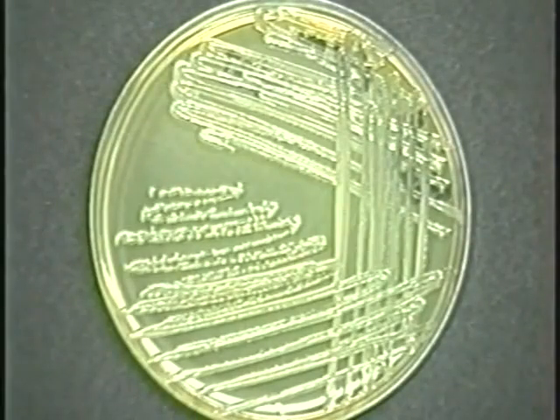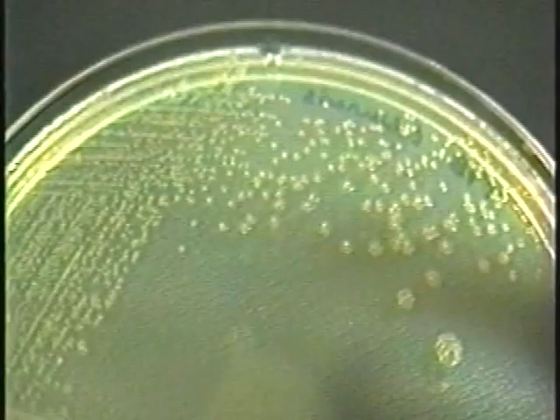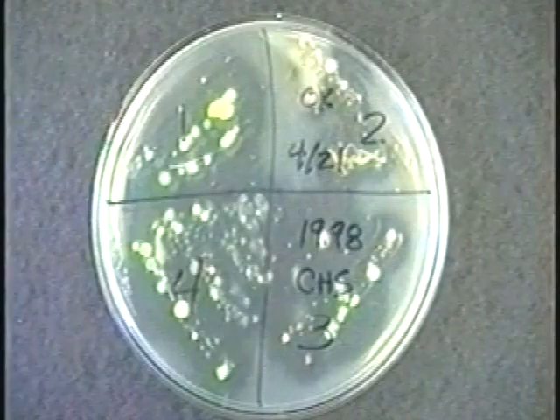Bacterial colonies will normally be visible within 48 to 72 hours of inoculation. The shape and pigmentation of the colonies should be noted. Varied types of colonies and those which do not grow on the streak lines usually indicate contaminants.